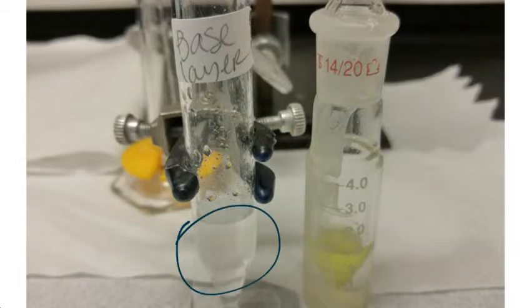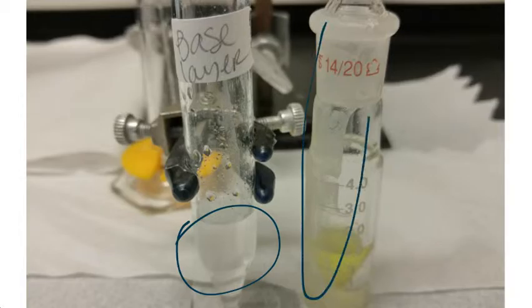This is what the base looks like after it's been separated out. It is important to point out that the student made an avoidable error here. As they were pouring and mixing, they spilled onto the outside of this container. Ether is highly volatile and evaporates immediately, and the sample crystallizes on the outside. The student is not going to be able to get this back. It's going to have to remain on the outside and be cleaned off, and this is going to lower the recovery at the end of this experiment.